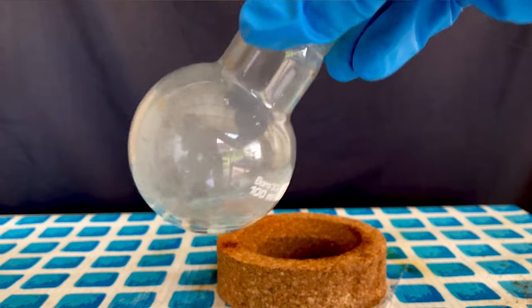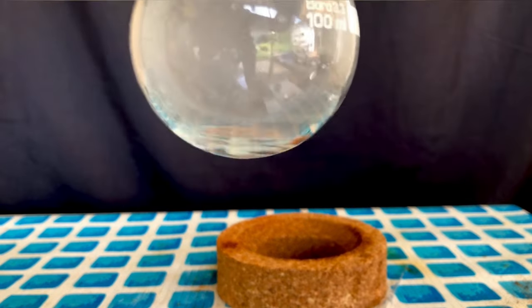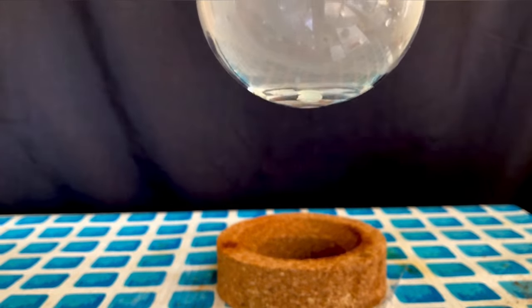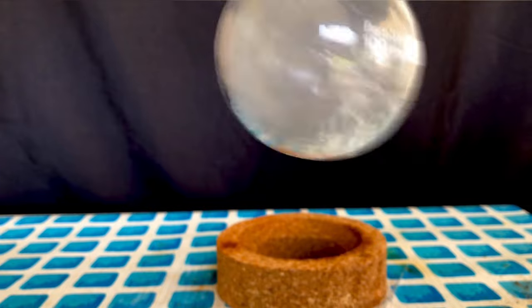Afterwards, I took a look at it, and I was astonished. Look closely, and you will be able to see a blob of phosphorus tribromide sitting under the water and not reacting.